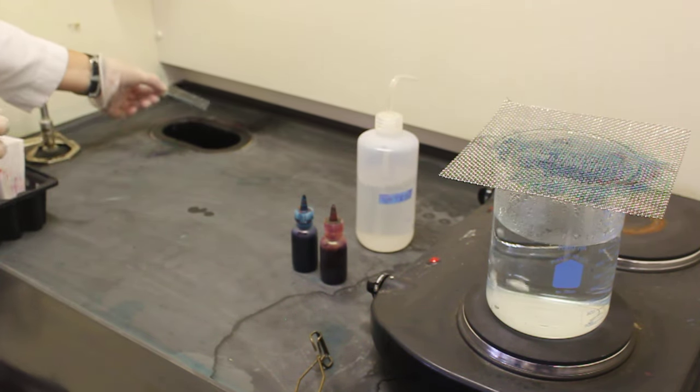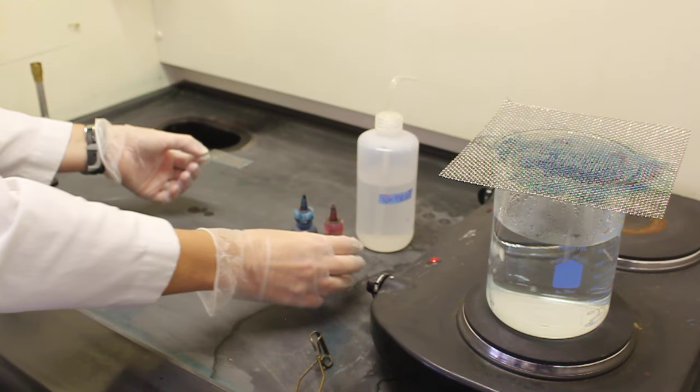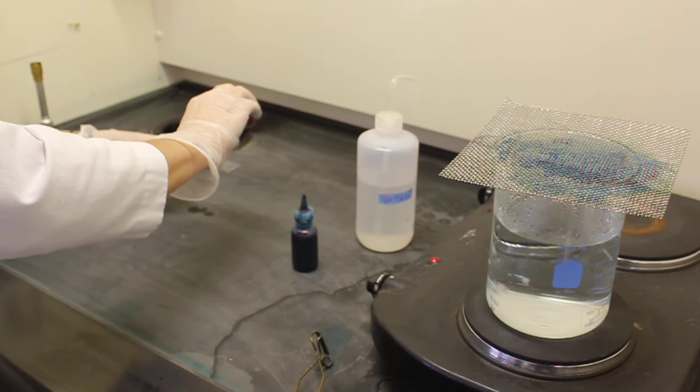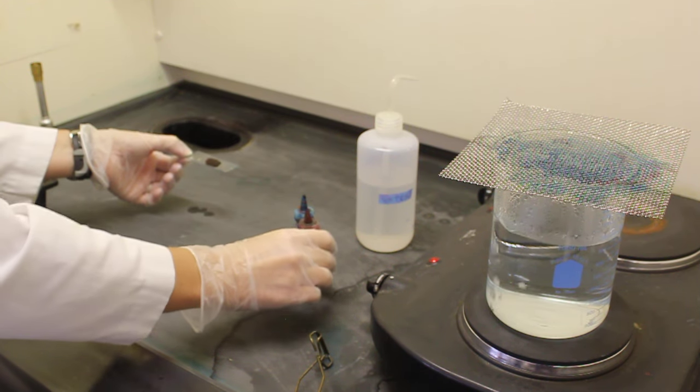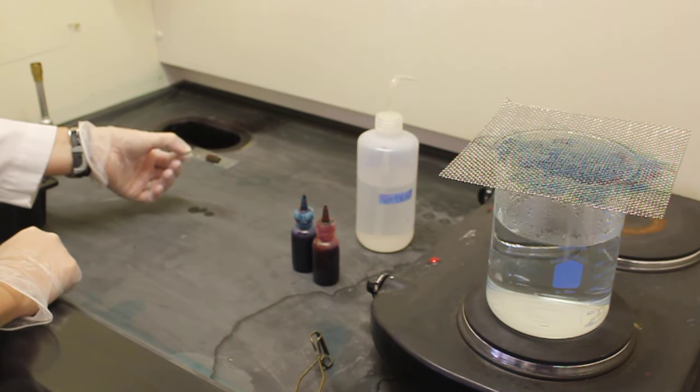I am now ready for my final step, the counter stain. I apply the safranin on top of my smear. This is allowed to sit for one minute.